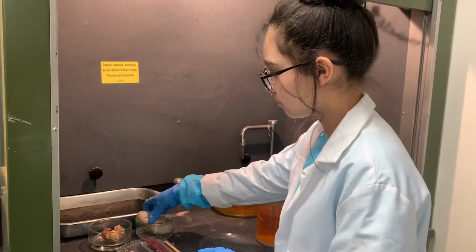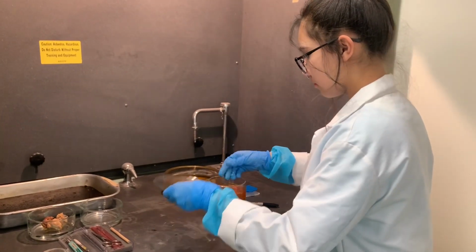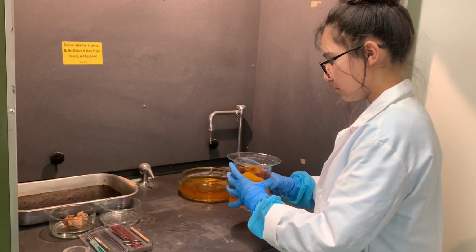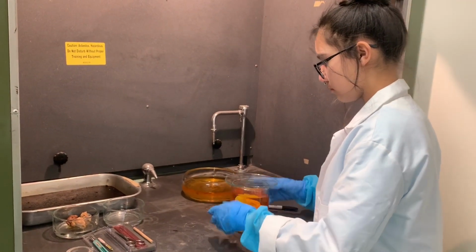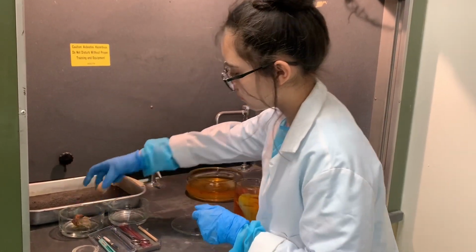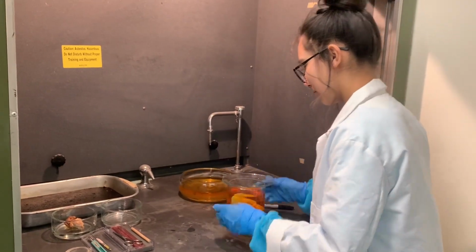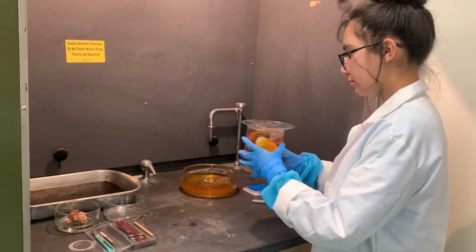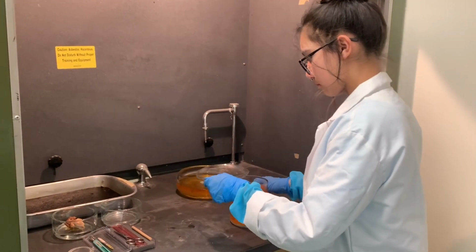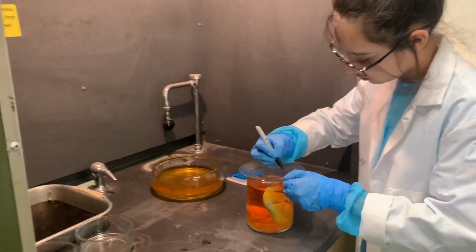I then submerge the organ samples into the fixative solution and swirl around the container to ensure the tissue sample does not stick to it or any of the other specimens. I replace the cap over the container after each tissue is added to the formalin, as one container can be used for several different types of tissue samples. For example, you can see I also add an eyeball specimen to the jar.